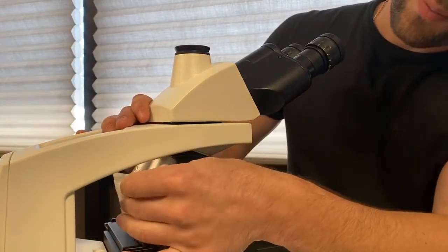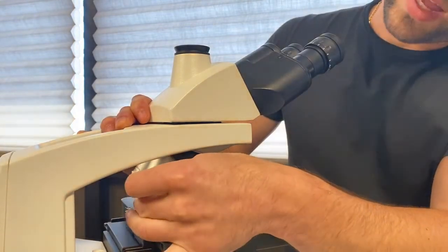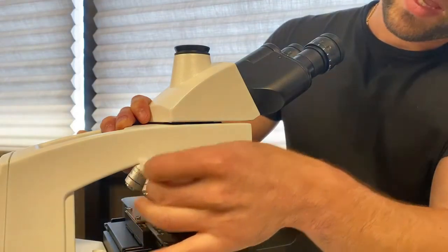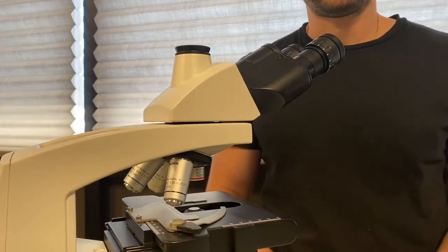Remember to wipe clean any excess oil that remains on the front lens of the 100x objective. If you forget to do this, eventually the oil will seep inside and damage the objective lens.